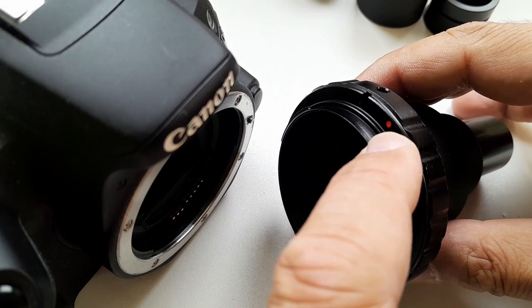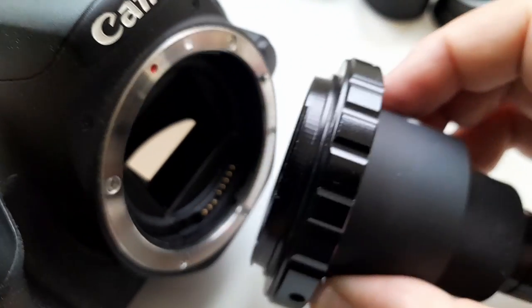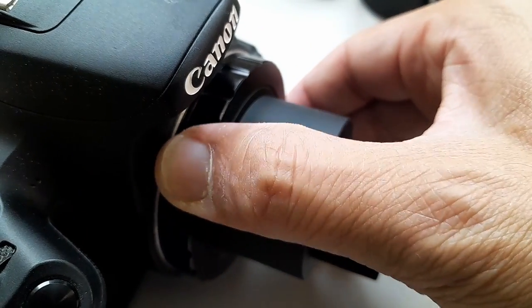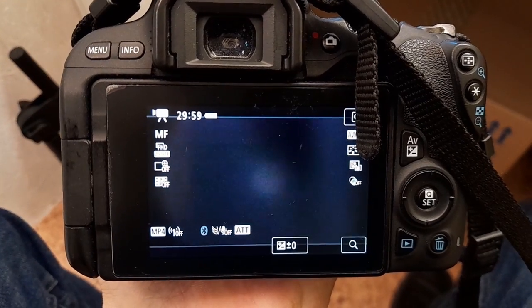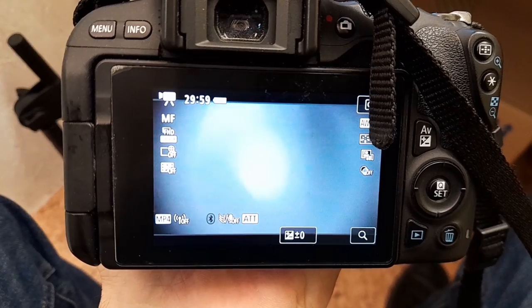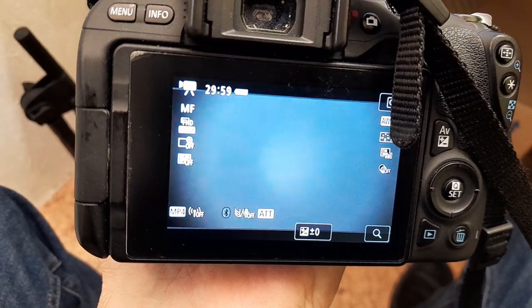Yeah, there's a red dot here on the mount as well, so that you know how to connect it. So just like a camera lens, like a camera objective, it goes on and it snaps on, and we're ready to go. And the first thing that I tried out is I tried to open and close the diaphragm, and I could already see that this really does not reduce the glare very much. It just reduces the field of view. So that means you see just a white circle in the center.